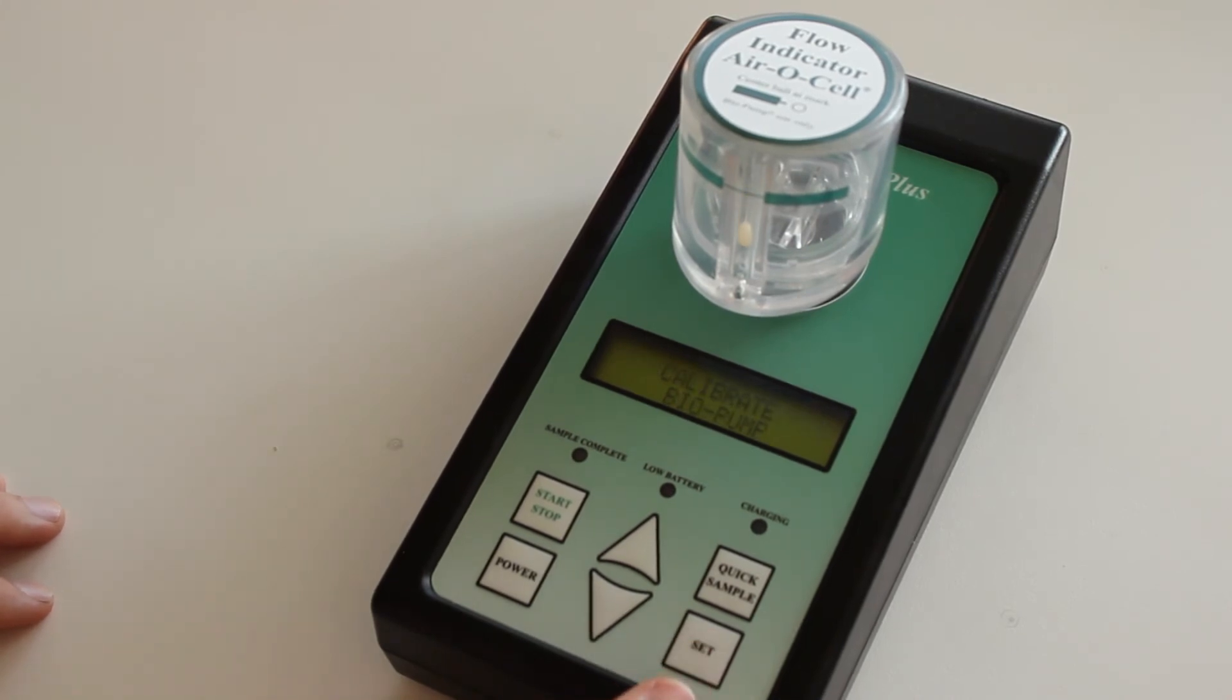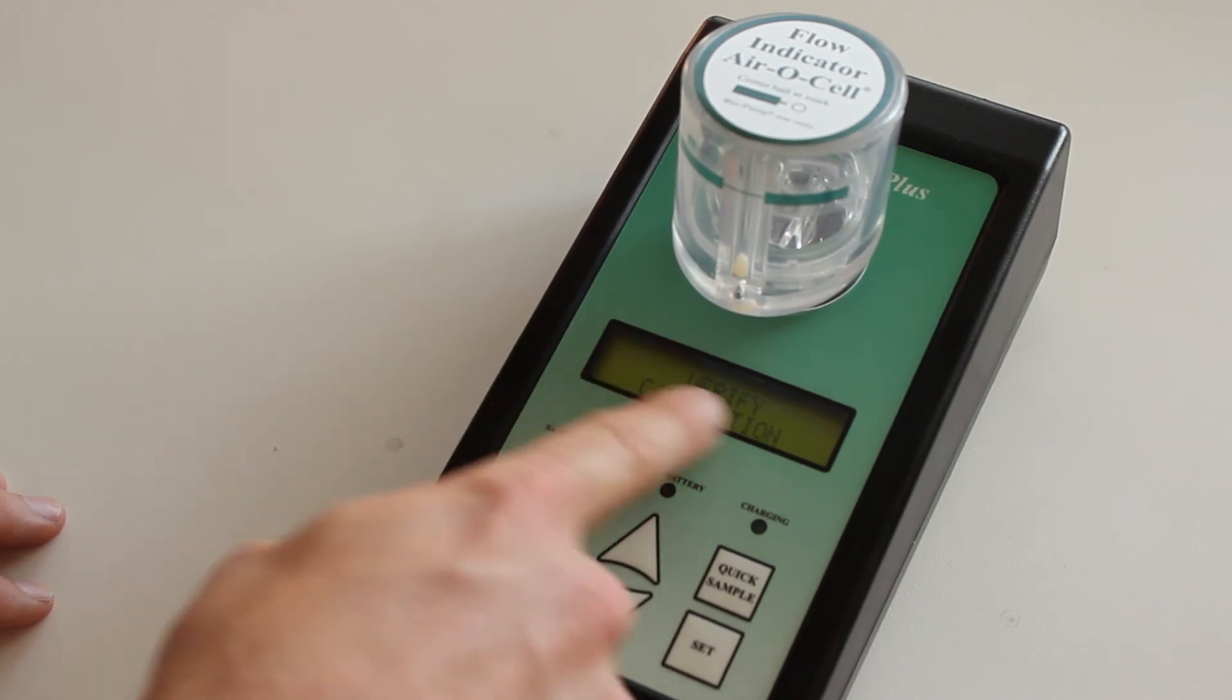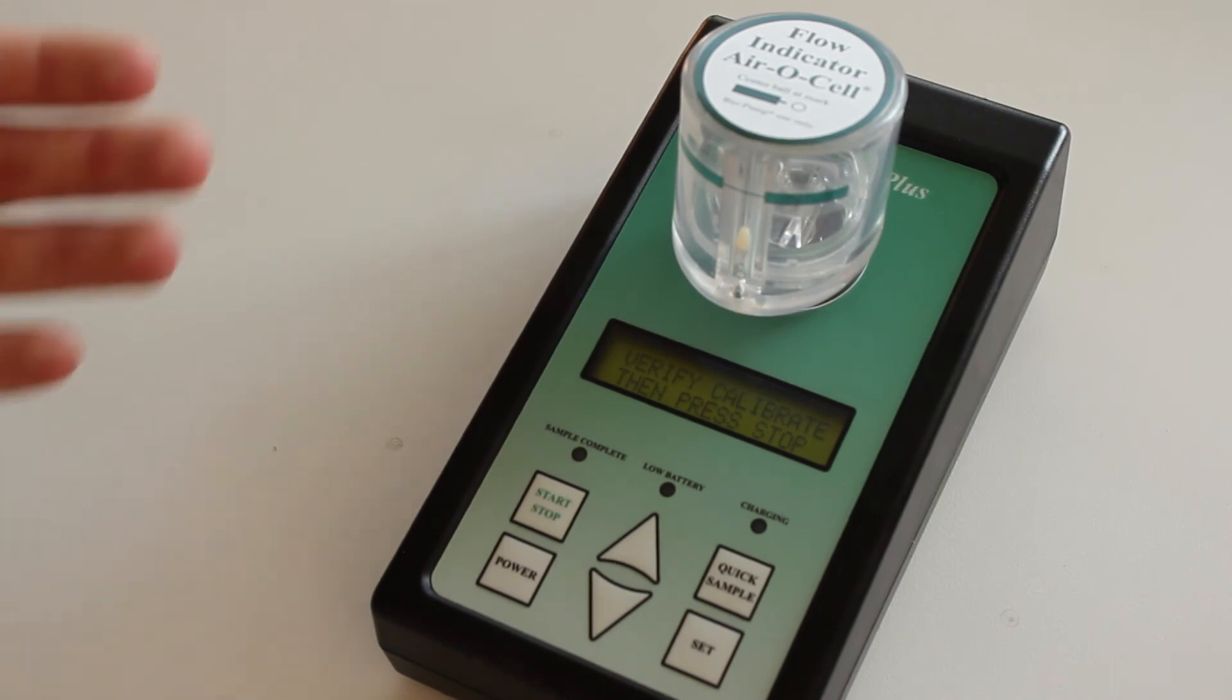It'll turn off and then you have the ability if you want to where you don't have the capacity to change it up and down but you just want to verify your calibration, you press up, verify calibration and set, and it'll wind up.